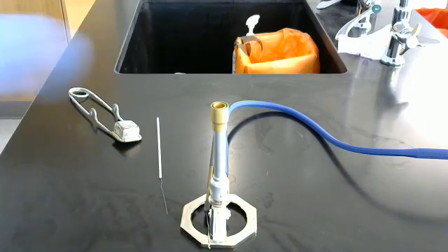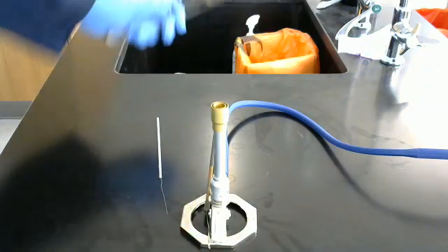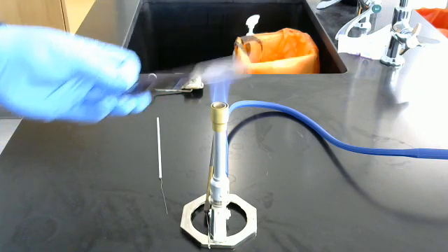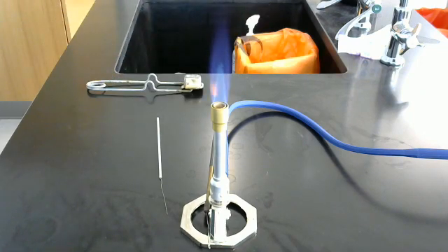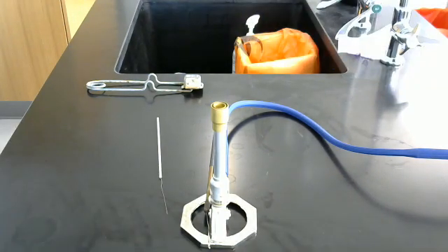I already have our Bunsen burner set up here, so we're going to turn on the gas, turn on the fire. One, two, three. That's heat fixing. And we are done with that. And that is how we create a heat fixed smear prep.